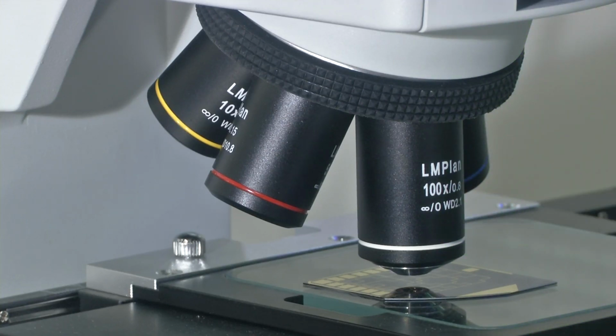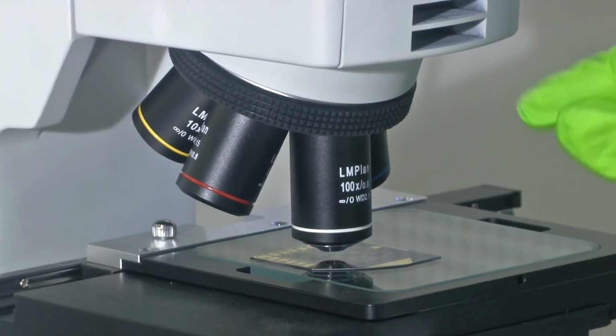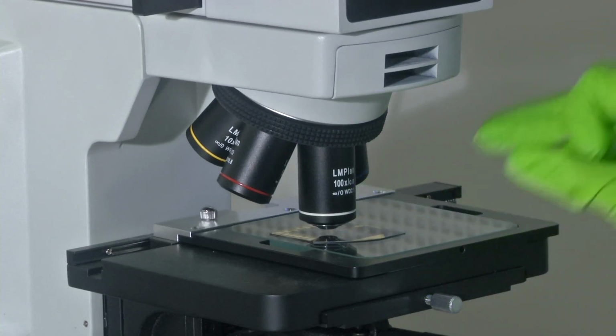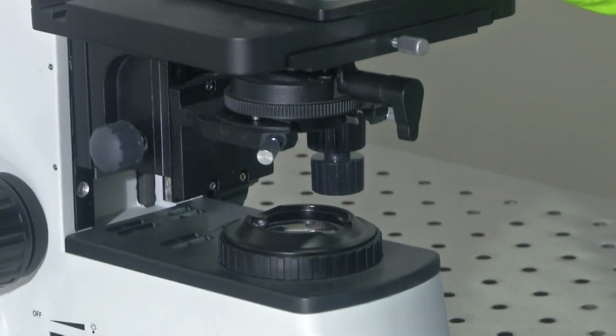Working distance is the amount of distance which has to be maintained between your sample on your stage and the objective lens which is capturing the reflected or the transmitted light image. That distance can be read from what is mentioned on this nose. So, always ensure you do not just use a different magnification, but also vary the working distance according to the specification mentioned here. Only then could you easily identify the fine features which you are trying to study or understand.